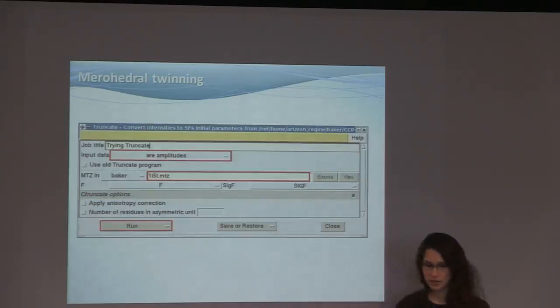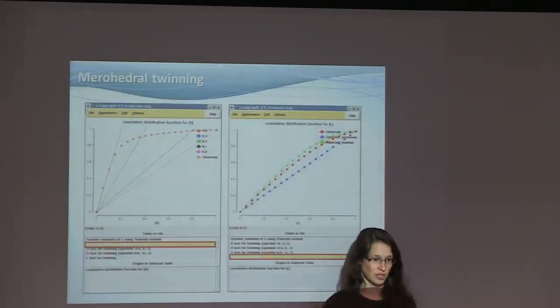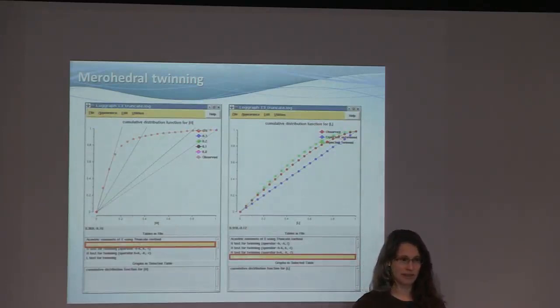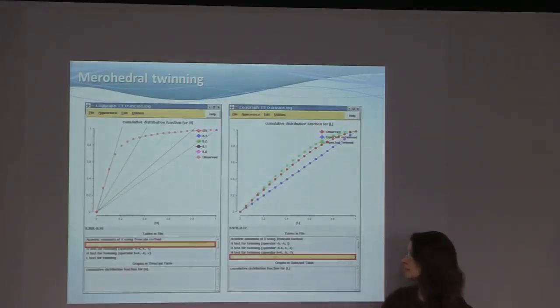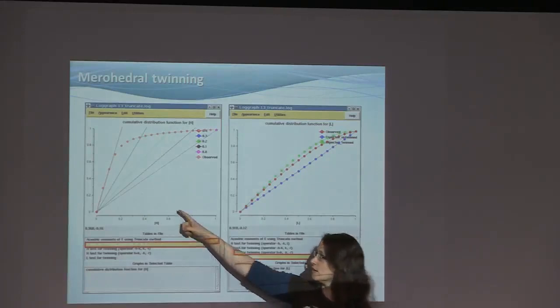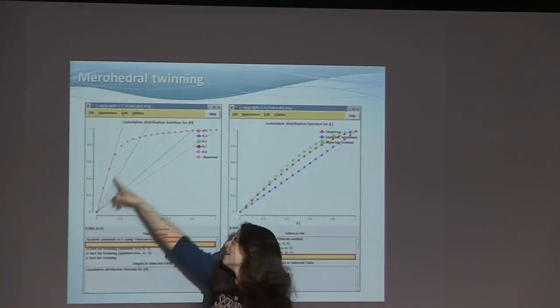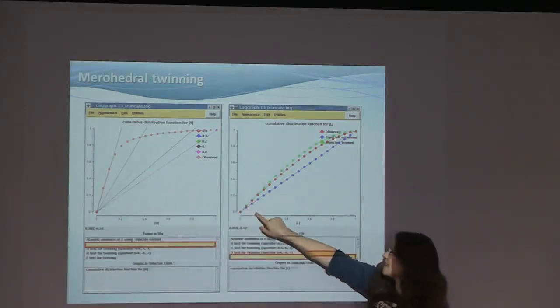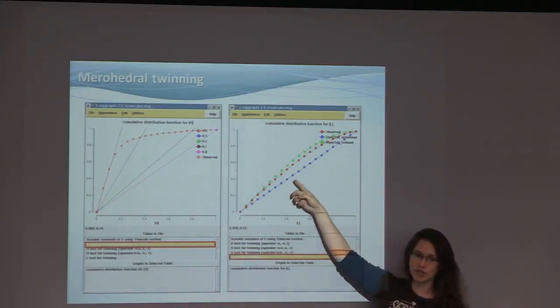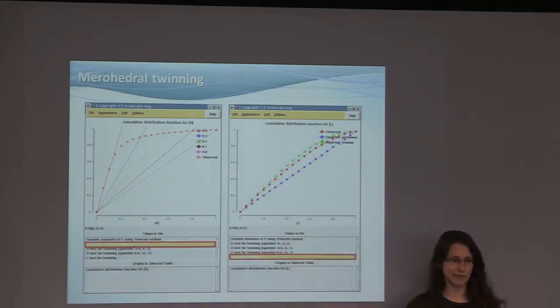So if you are wanting to do this in the old CCP4 GUI, you run truncate in a very normal fashion, just giving it the MTZ file and click run. And you get two plots which look like this. So after the last 5 minutes, if you were here, this should now look vaguely familiar. There's the H test, giving you a twin fraction of about 0.4 here, and it's sloping off again. And then if we look at the L test for the same structure, we can see it's just below perfect twin, again confirming that we have 0.4.